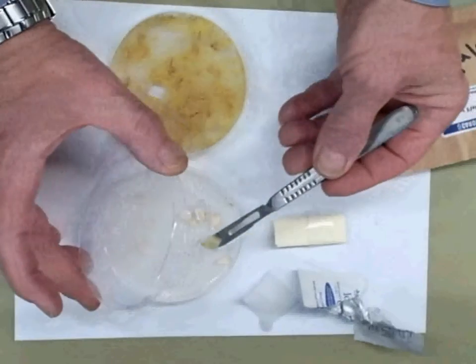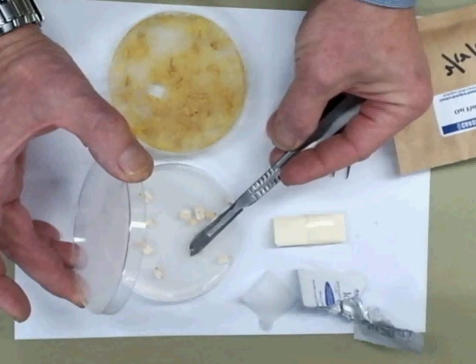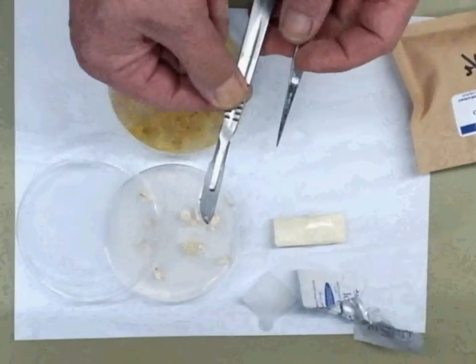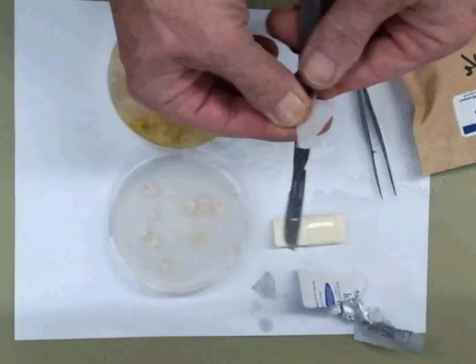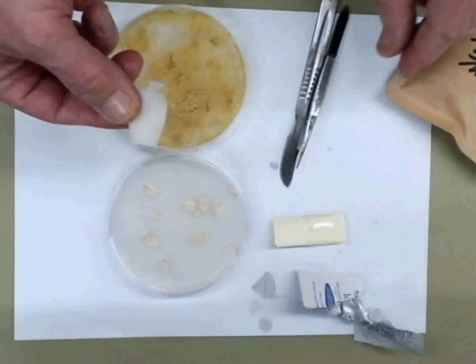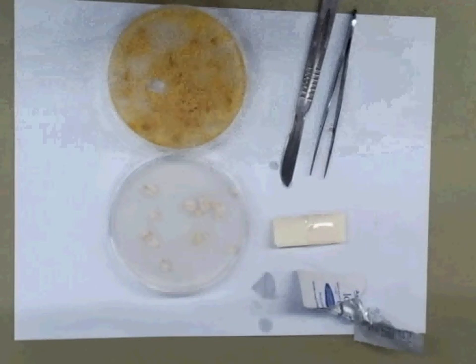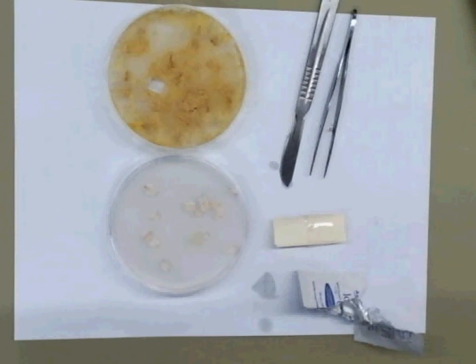I'm going to place it face down right near one of the oat flakes — just let it come off, with a little help from the tweezers. Then I'll clean up my scalpel and tweezers. In about 24 hours that will probably be going very nicely. And that's how you subculture the Plasmodium stage of Physarum using the chunking technique.